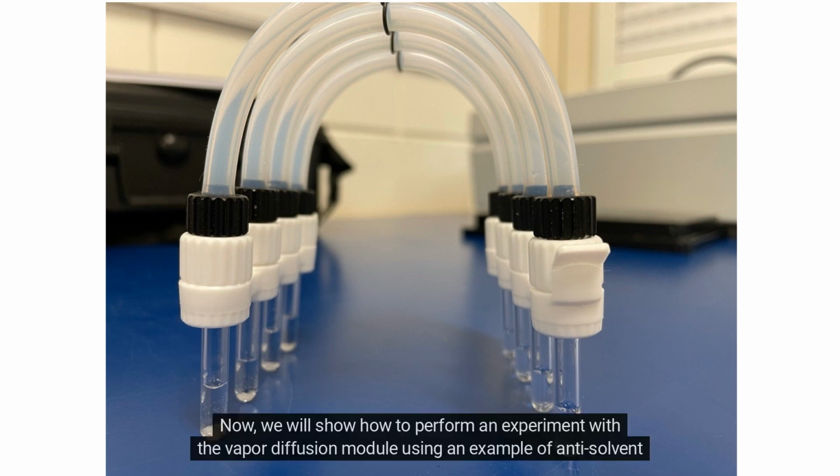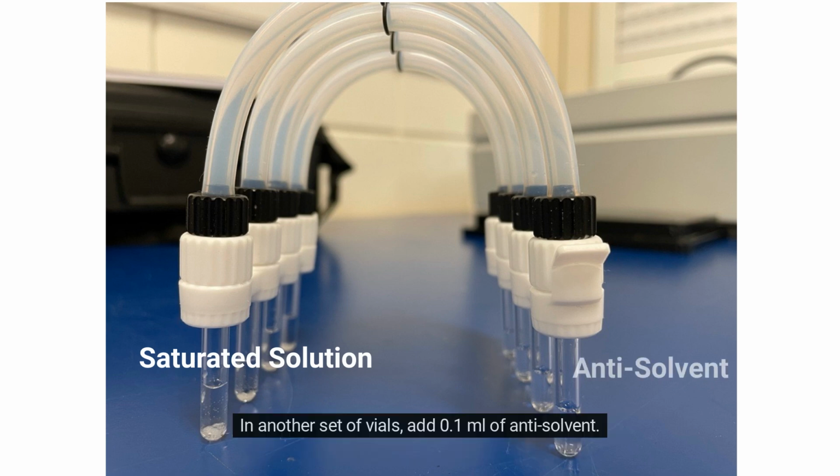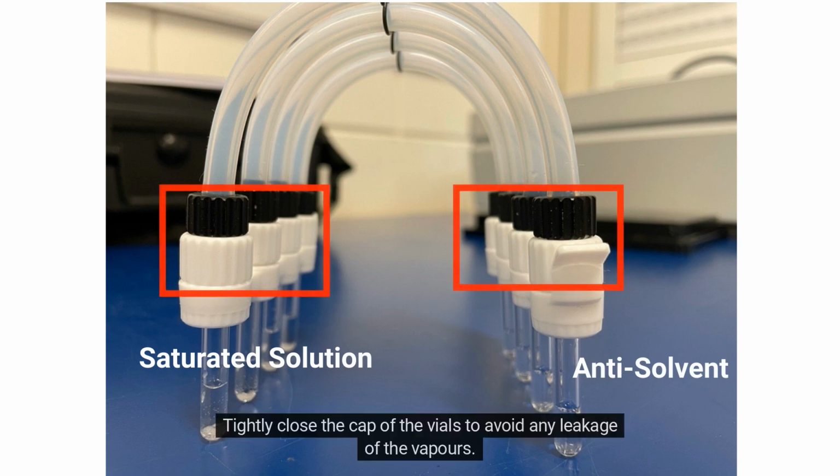Now, we will show how to perform an experiment with the vapor diffusion module using an example of antisolvent crystallization. To prepare the sample, add solute to 0.1 milliliters of solvent to form saturated solution in one set of vials. In another set of vials, add 0.1 milliliters of antisolvent. Tightly close the cap of the vials to avoid any leakage of the vapors.